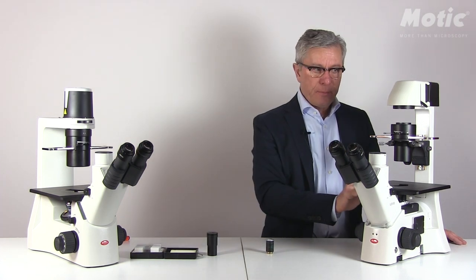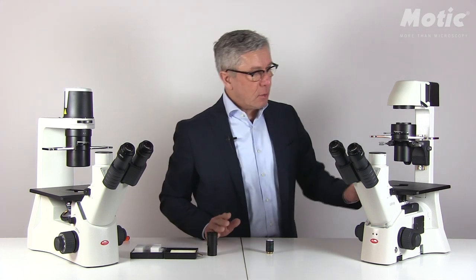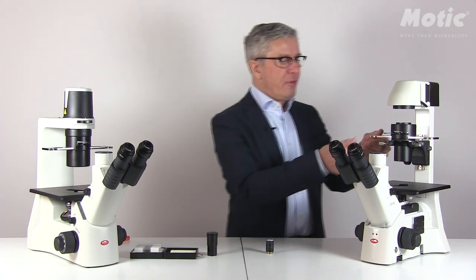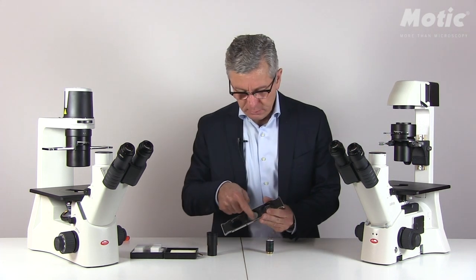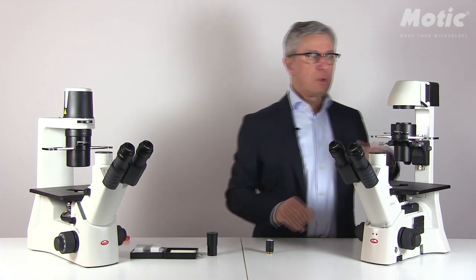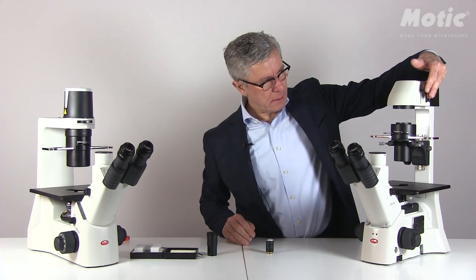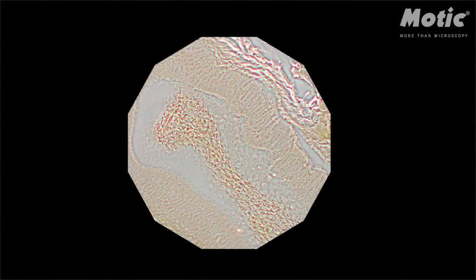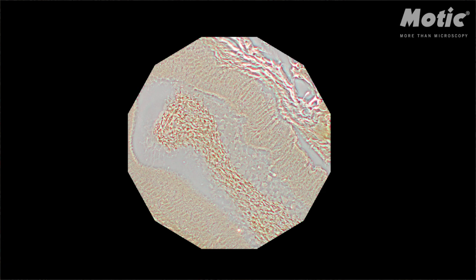For the AE31 Elite, you have to do some more handling. Place your sample on top of the stage and focus. Move the slider into an empty option. Close the field diaphragm and move the condenser in terms of height until you get the bright spot in the middle of your field of view. Then open the field diaphragm again and adjust the contrast by using the aperture diaphragm. With all these steps, the Köhler setup is done properly.